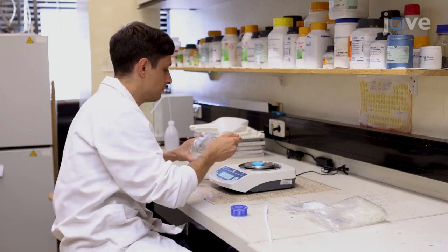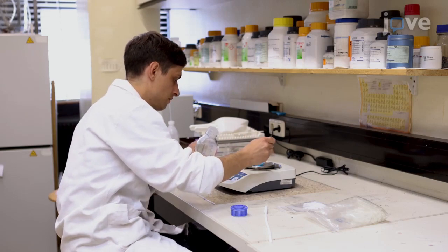Thereby, the lysis of the material and pre-purification before analysis are the central steps. The protocol includes different steps during the sample preparation. These steps must be planned and prepared very well before starting with the sample processing. For example, the preparation of fresh buffers is important.